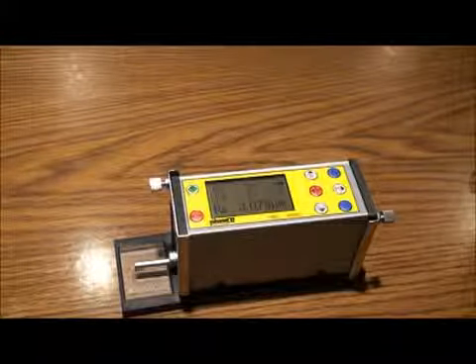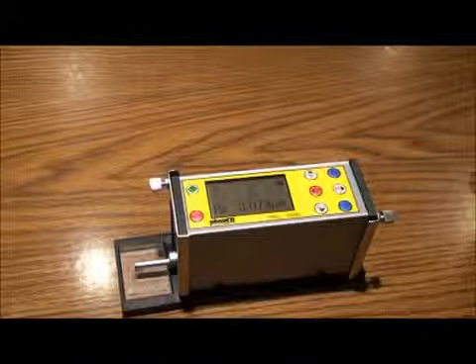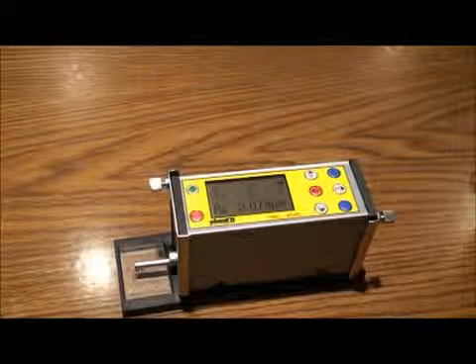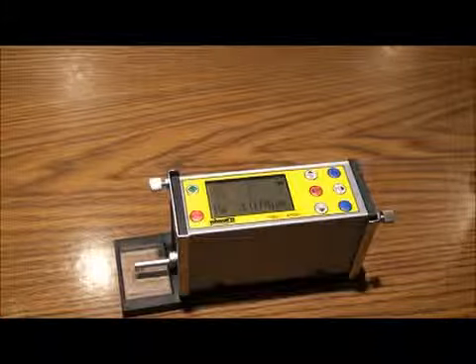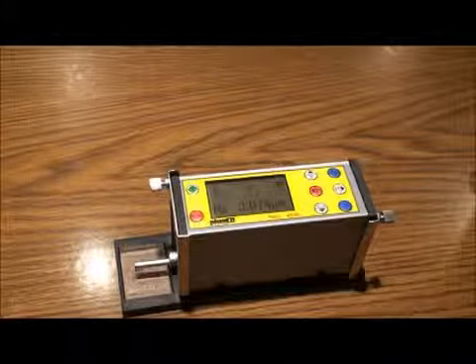Once you have all parameter settings complete, let's demonstrate how to perform taking a test. Place the unit to test the supplied calibrated reference sample. Check the stylus level to make certain you are in zero range.